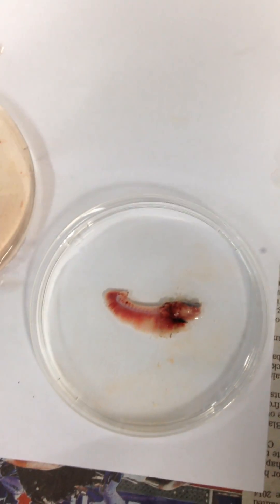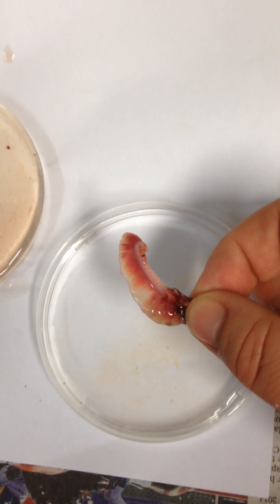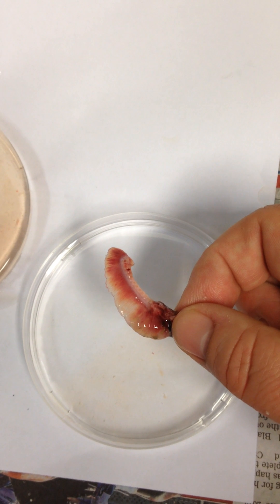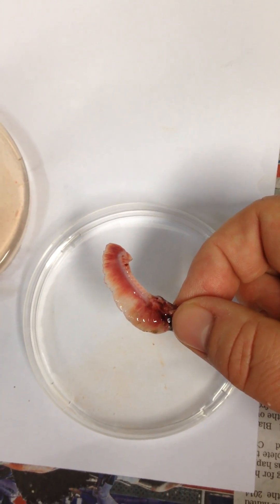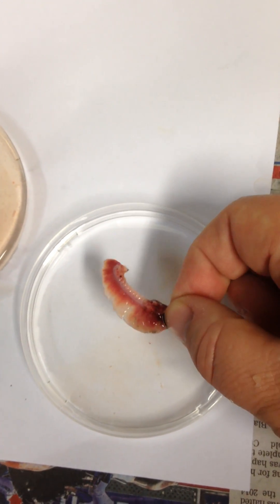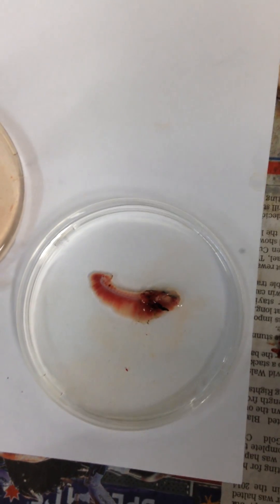So the fish is able to extract oxygen from the water. When we pull it out of the water the fish will die of lack of oxygen because the gill filaments clump together and there's less surface area being exposed to the water, so even though there's more oxygen in the air than there is in the water, the fish is unable to extract enough because the filaments are too clumped together.